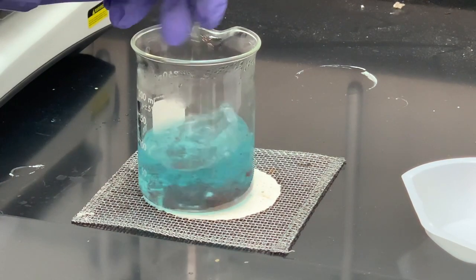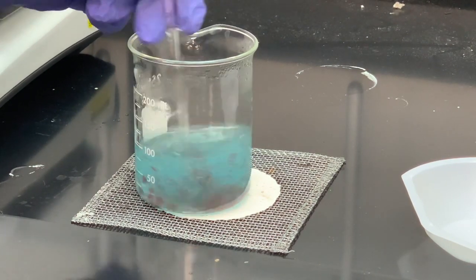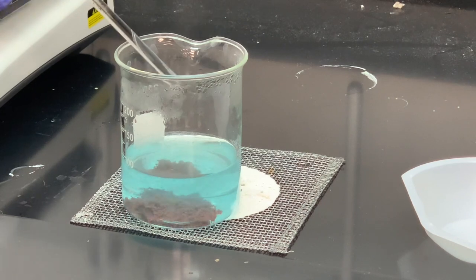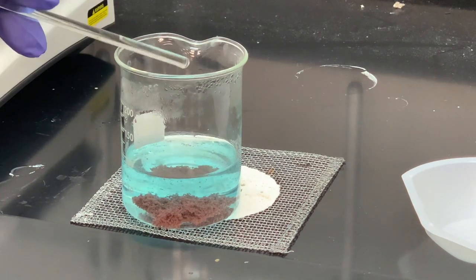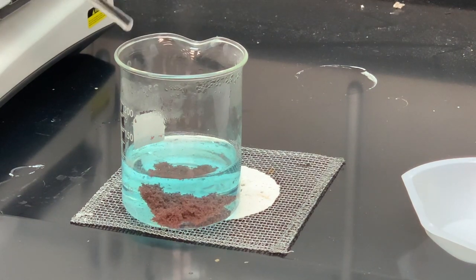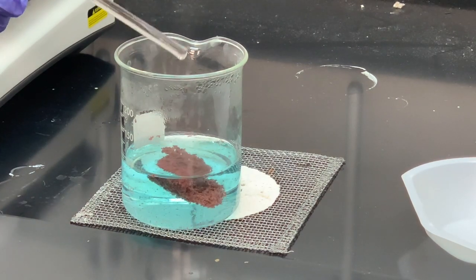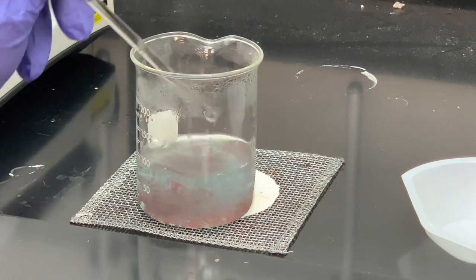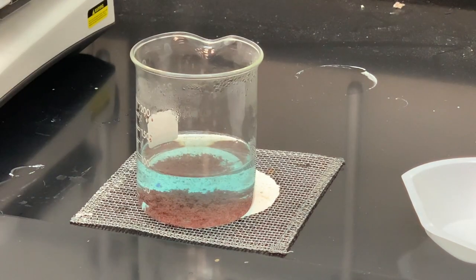So what would it look like if copper sulfate is completely consumed? What would it look like if zinc was completely consumed? I'm still seeing bubbles coming out of this reaction, so it hasn't subsided yet — I'm going to keep stirring. Once the reaction has subsided and all the gas and copper that's going to form has been made, we'll decant this into the acidic waste container. The book does suggest heating this up to help the reaction, so I'm going to put this back on the hot plate and stir it.